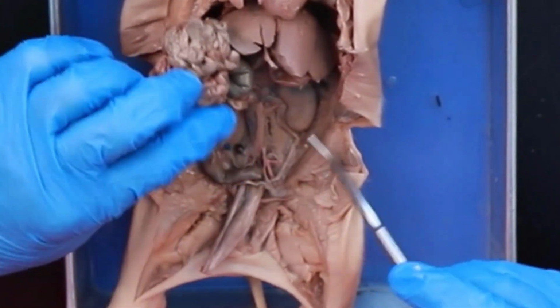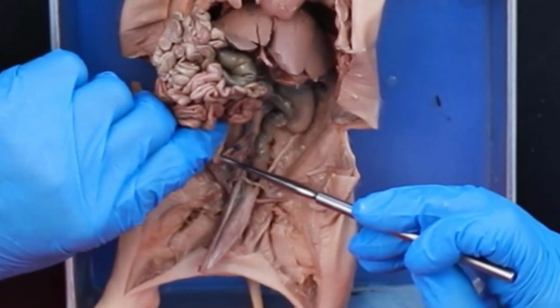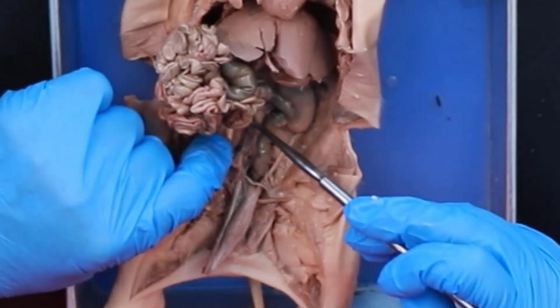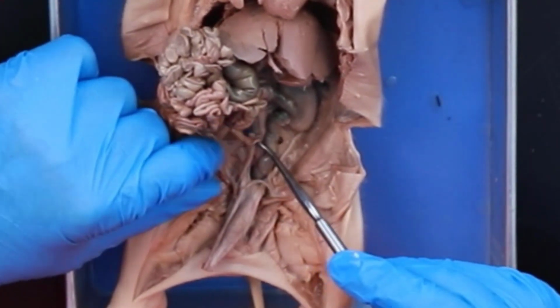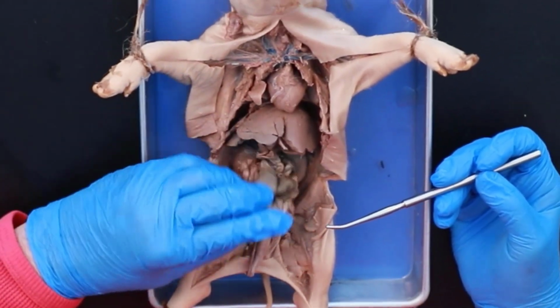In these particular guys, because they're so small, it's really hard to tell, but I can see that this is actually a female because I can see the ovary coming down here. The vessels actually start up here by the kidneys, and I can see it coming down. So this is actually a female. This would not be something I would ask you on a test because it's really hard to do.